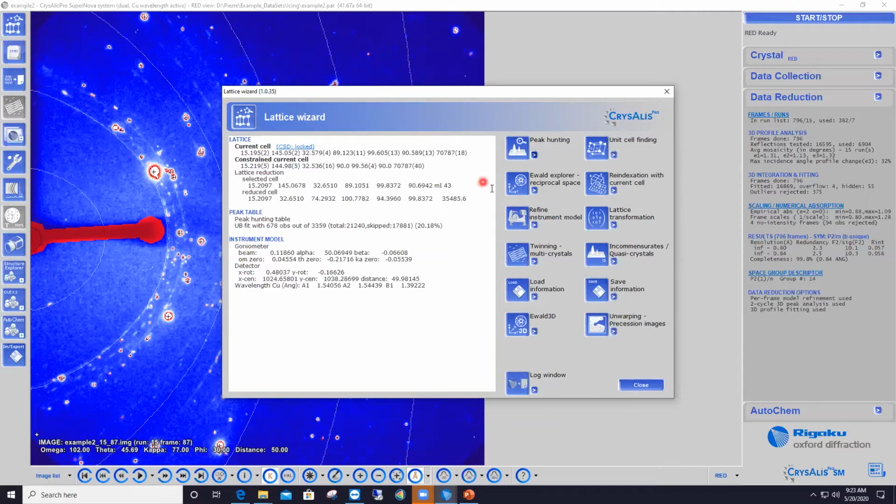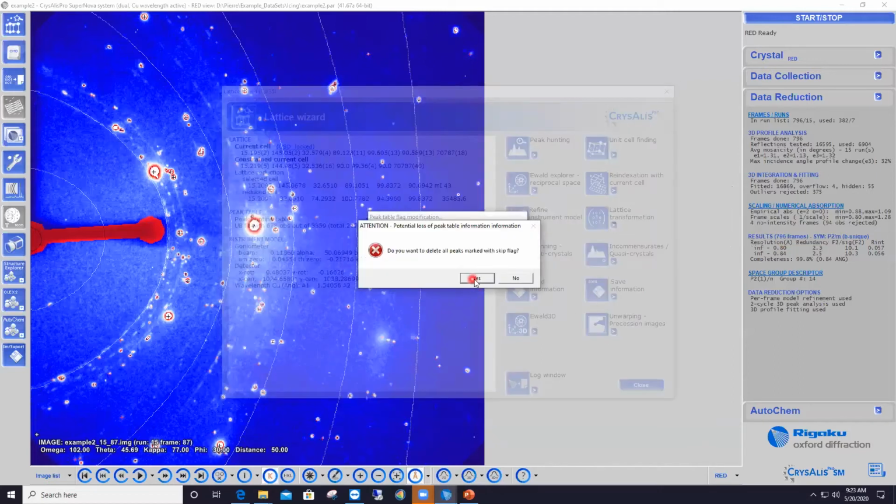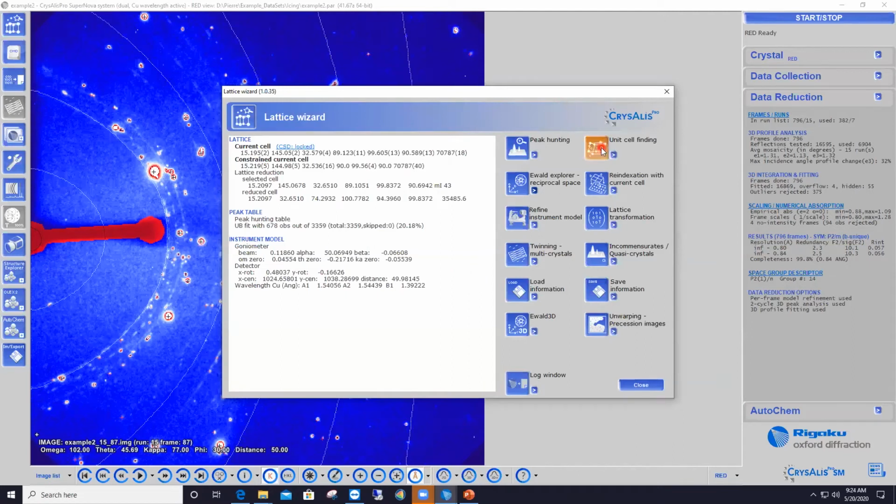So to do that, I click on the little arrow button that is beside the main button for the Ewald Explorer. So I click on that little arrow button to have access to more advanced features. And then I select the second option that says Peak Table Flags. And in the dialog that opens up, I go down to the bottom of the list and select Delete Skip. By doing that, I will delete all the reflections that have a flag skip assigned to them. So I click on it. CrysAlisPro asks me whether I really know what I'm doing here. So yes. And then now I can certainly run indexing again.